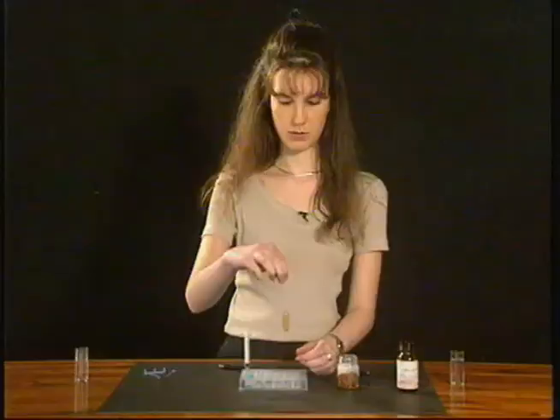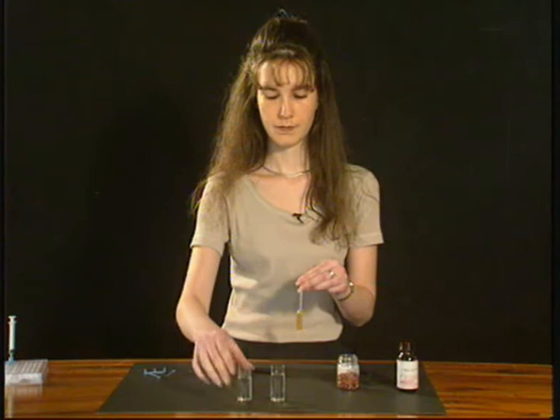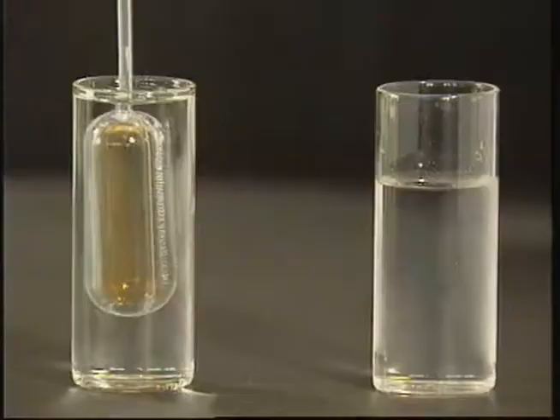Remove the combo plate and bring in your hot water and your cold water. Immerse the bulb of the propette in the hot water for about 15 to 30 seconds. Note that the colour of the gas in the bulb of the propette is dark brown.